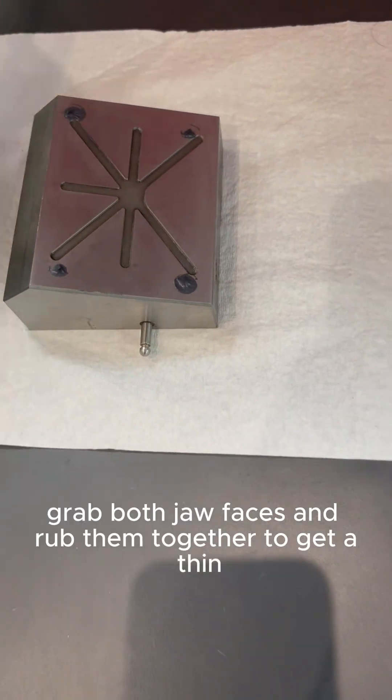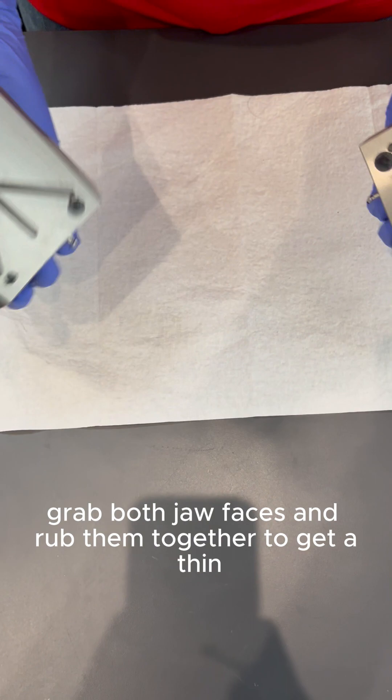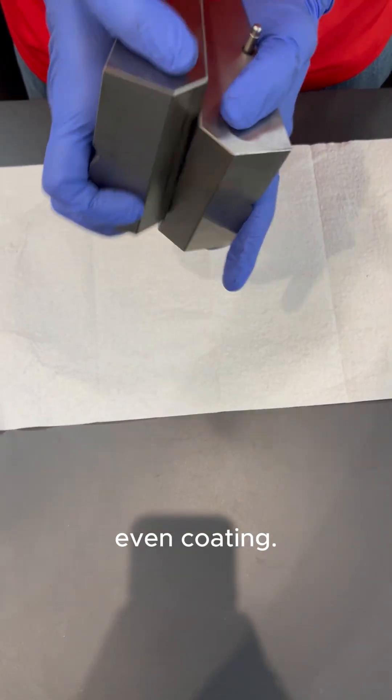Finally, grab both jaw faces and rub them together to get a thin, even coating.